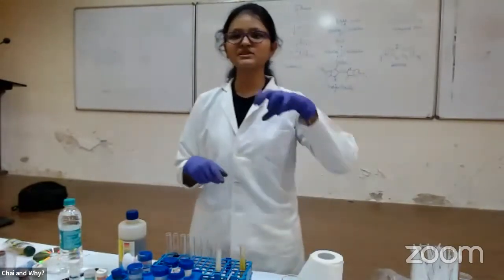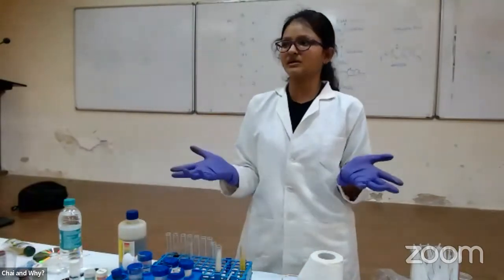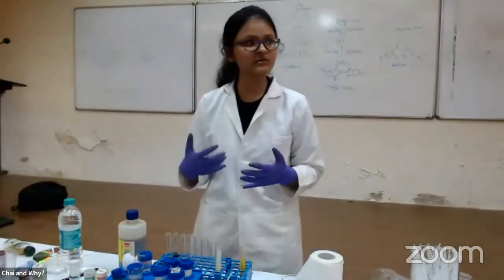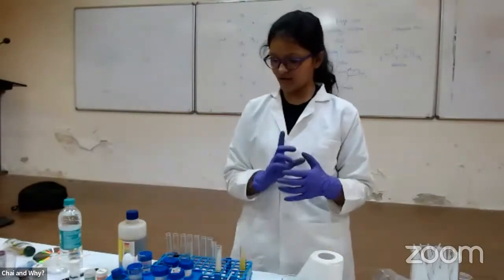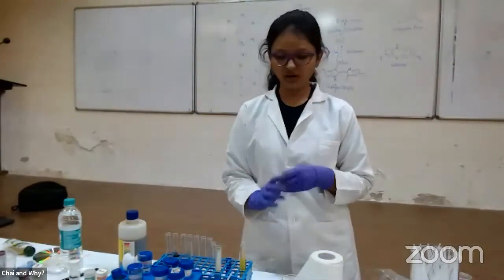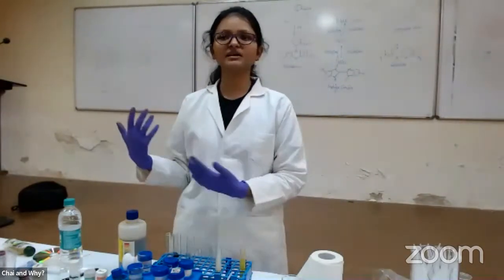It can't be that I go to buy fluorescein, come back and check, and it's not fluorescein, then it won't be sold in the market at all, and even if it were sold, I wouldn't buy it. Fine. So there are some dyes which are not stable, so we have to make them in the lab. So I'll show you a small reaction of how we make a dye in the lab, and how difficult and entertaining the entire process is.